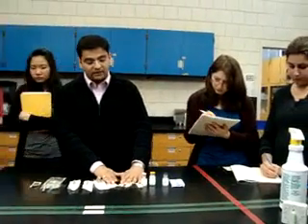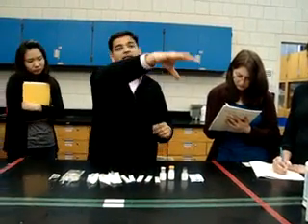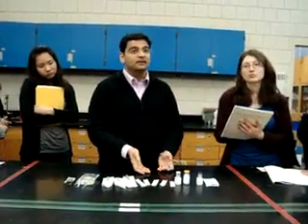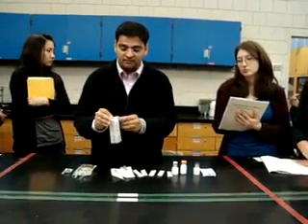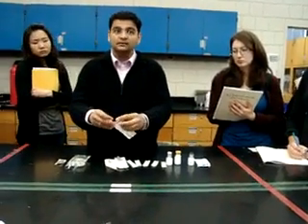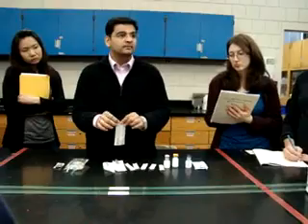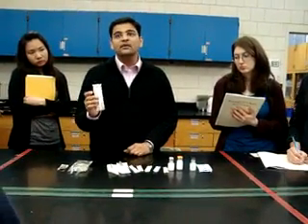What I suggest is: after you finish picking, there is going to be a small desk where you can prepare. In those 2-3 minutes, what I am going to do is just fold the syringe packaging — see these, this is where the syringe is open. Just fold them. Please do not open them. This is going to save your precious 2 minutes.